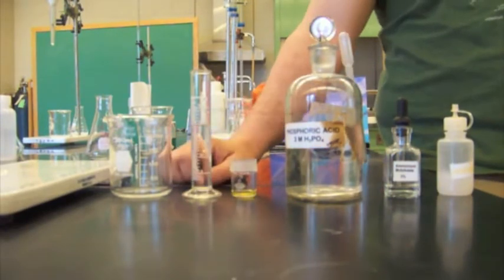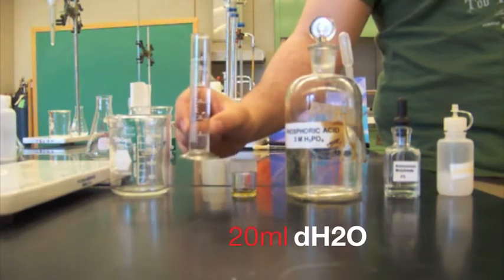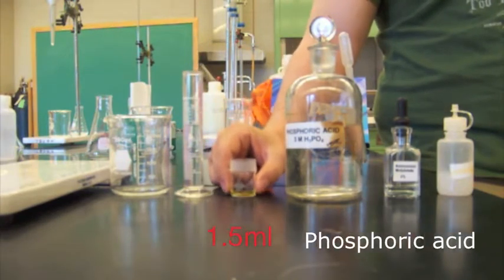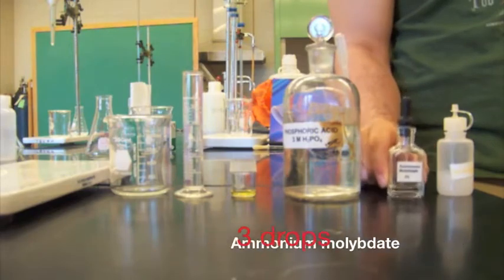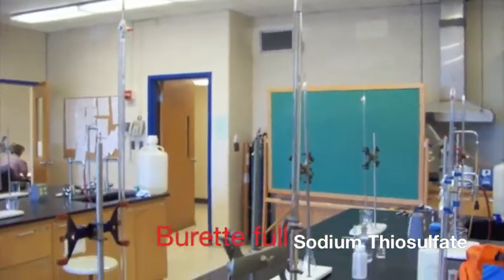For this titration, you're going to need 0.5 grams of bleach, 20 milliliters of distilled H2O, 1 milliliter of 0.5 molar potassium iodide, 1.5 milliliters of 3 molar phosphoric acid, 3 drops of ammonium molybdate, and a burette full of sodium thiosulfate.